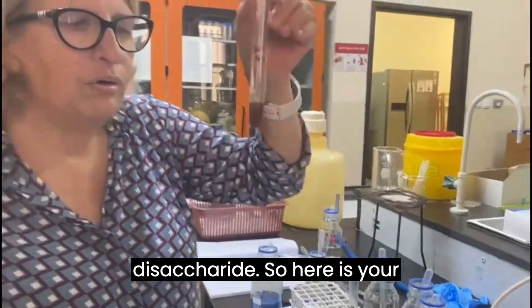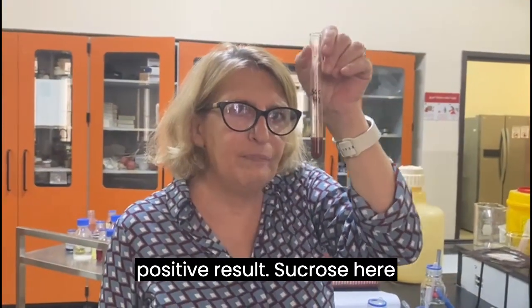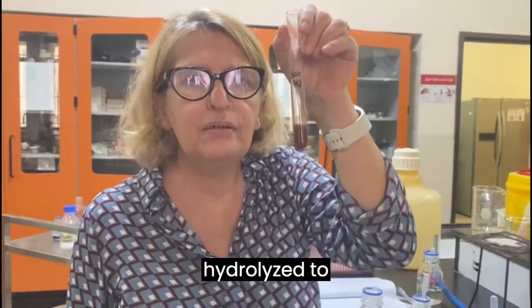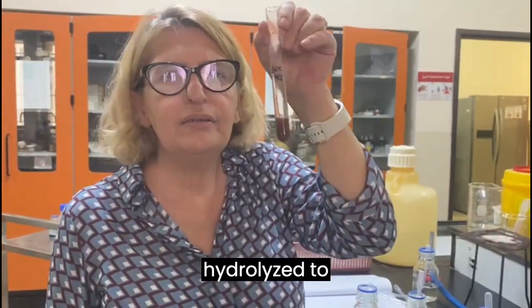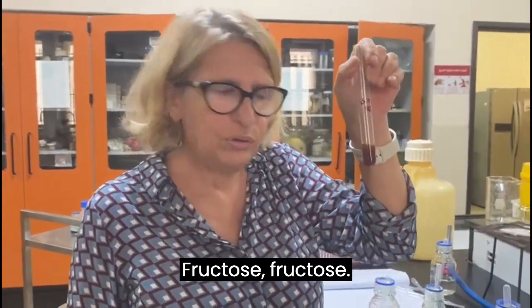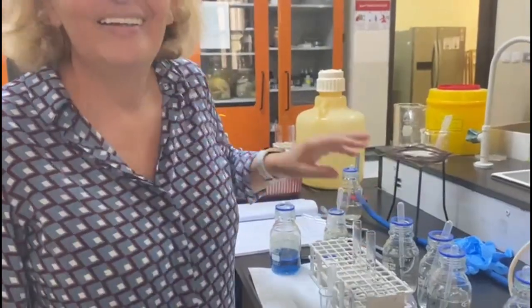So here is your positive result. Sucrose here is no longer sucrose. It has been hydrolyzed to 2 monosaccharides, glucose and fructose. Okay.